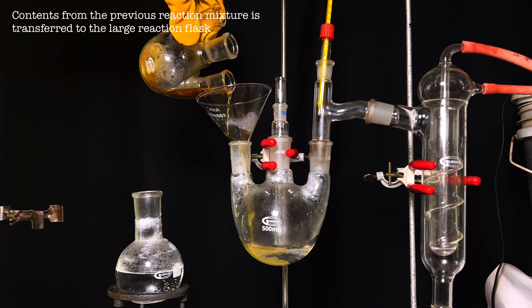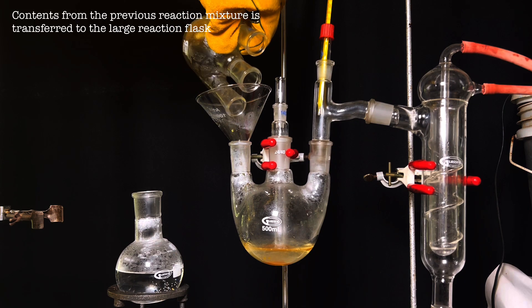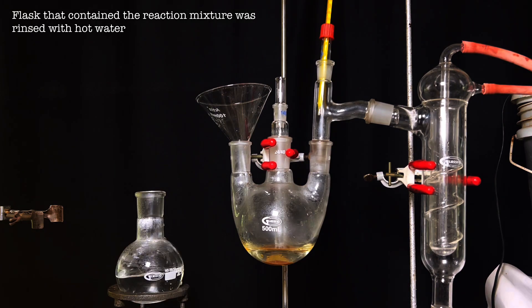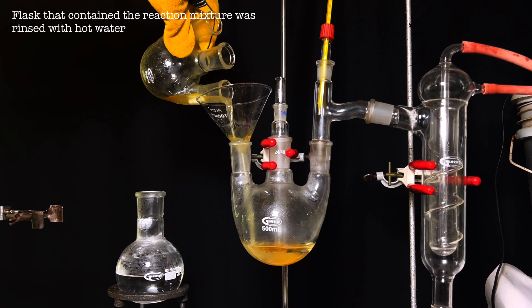Then, the contents from the previous flask which were refluxed for four hours was transferred into the bigger flask. The previous flask was rinsed with approximately 50 ml of hot water and that too was transferred to the larger reaction flask.